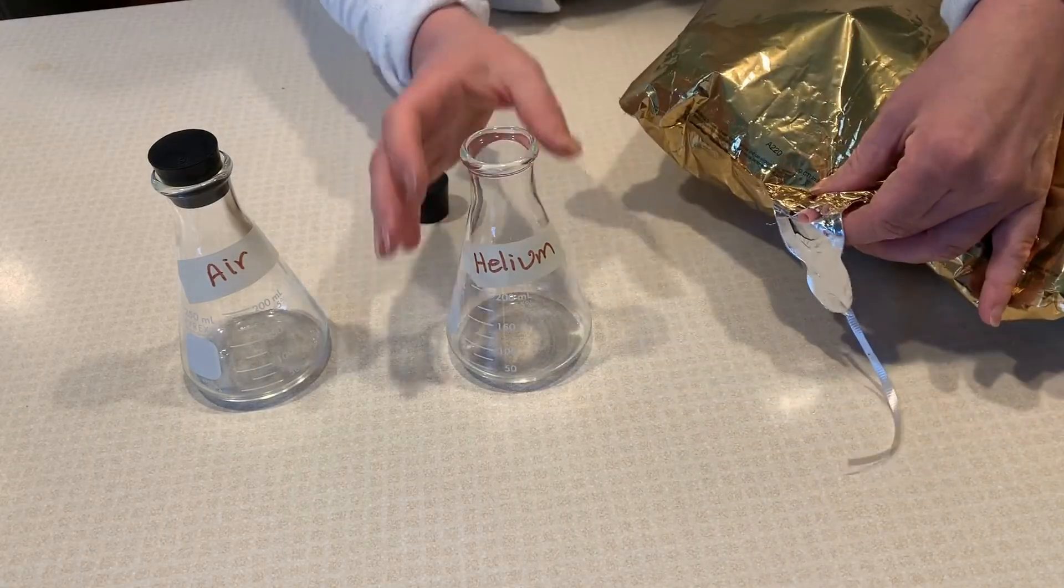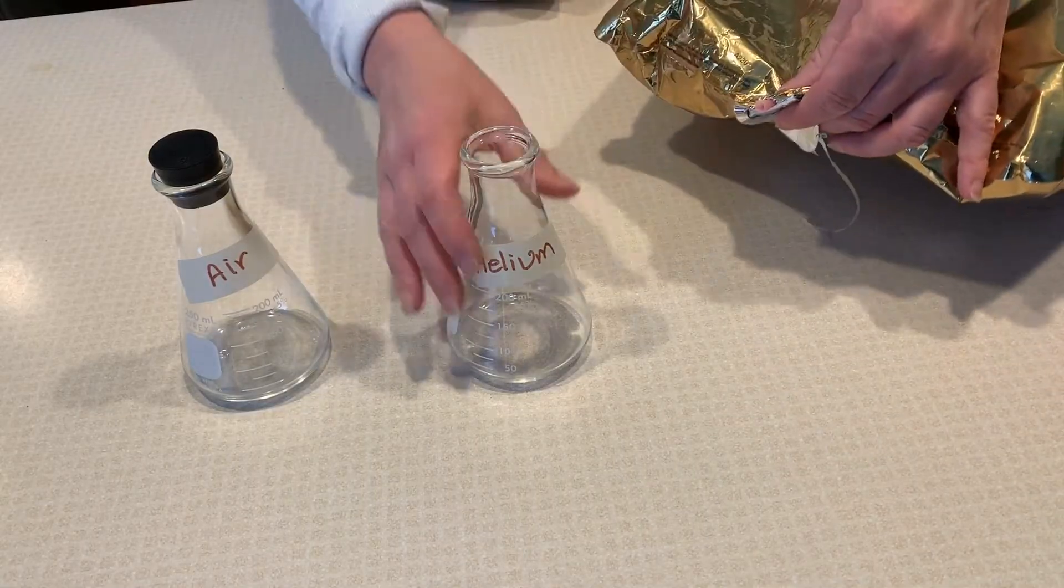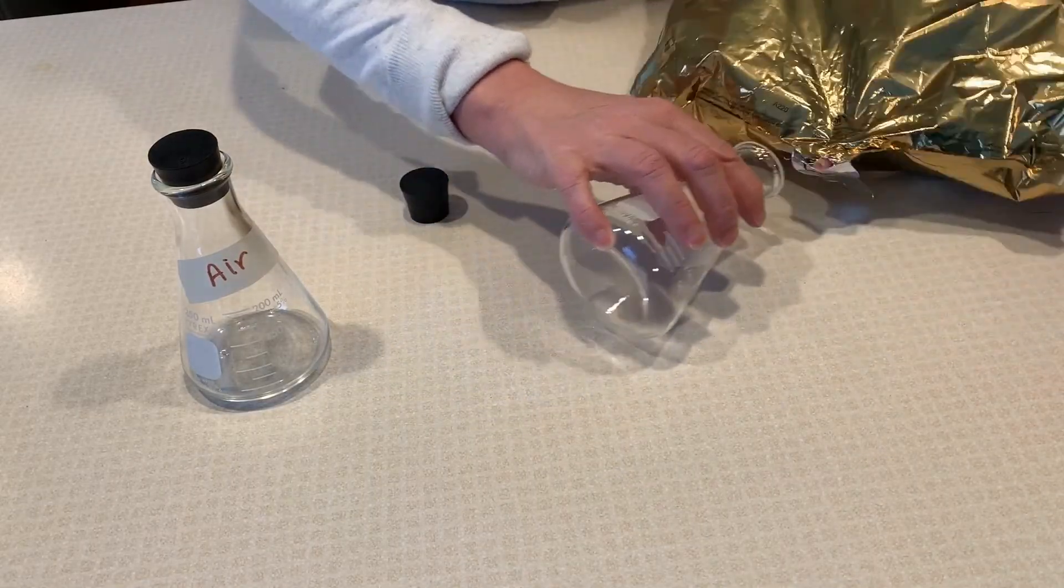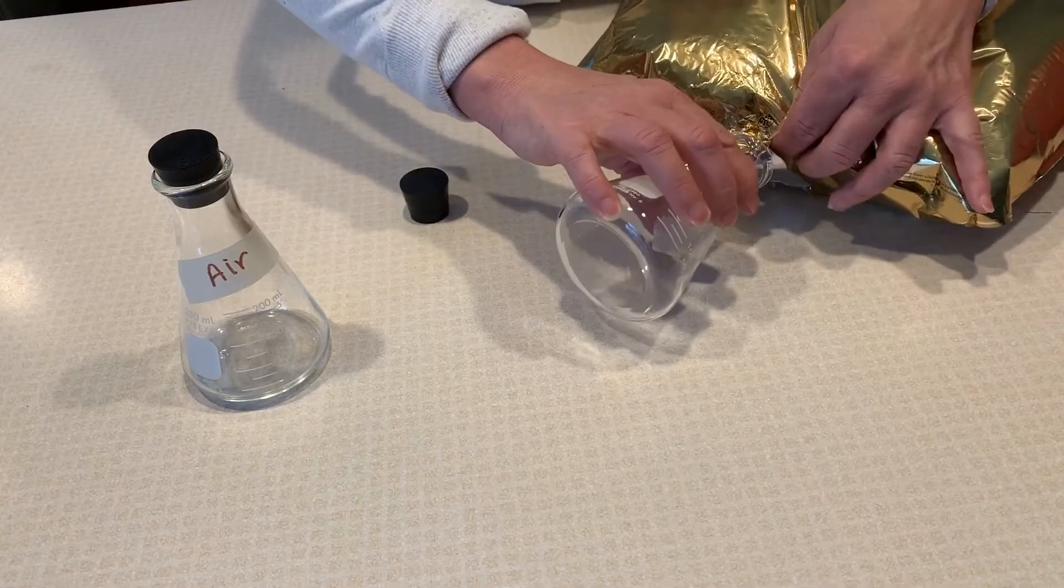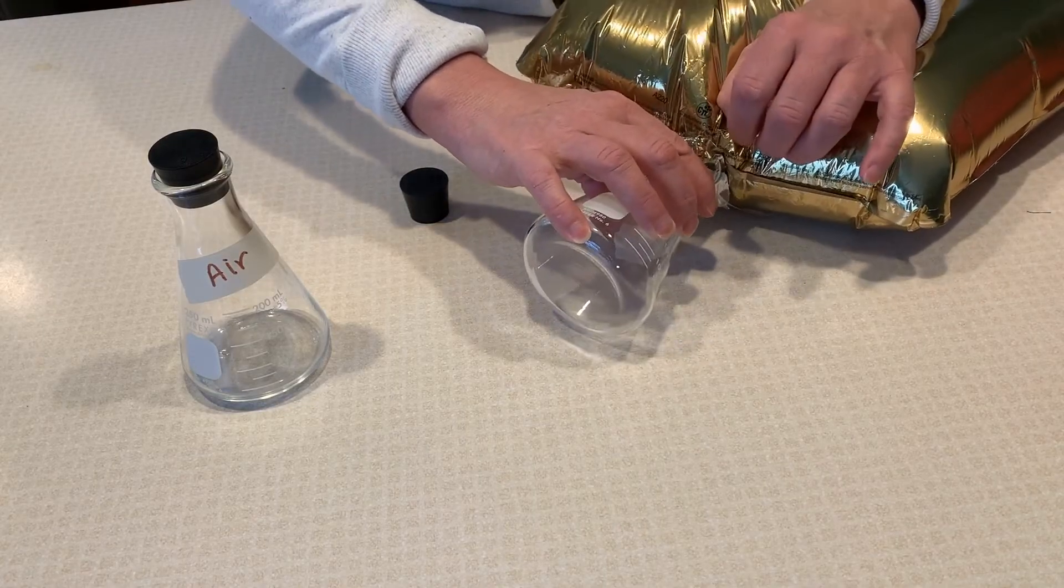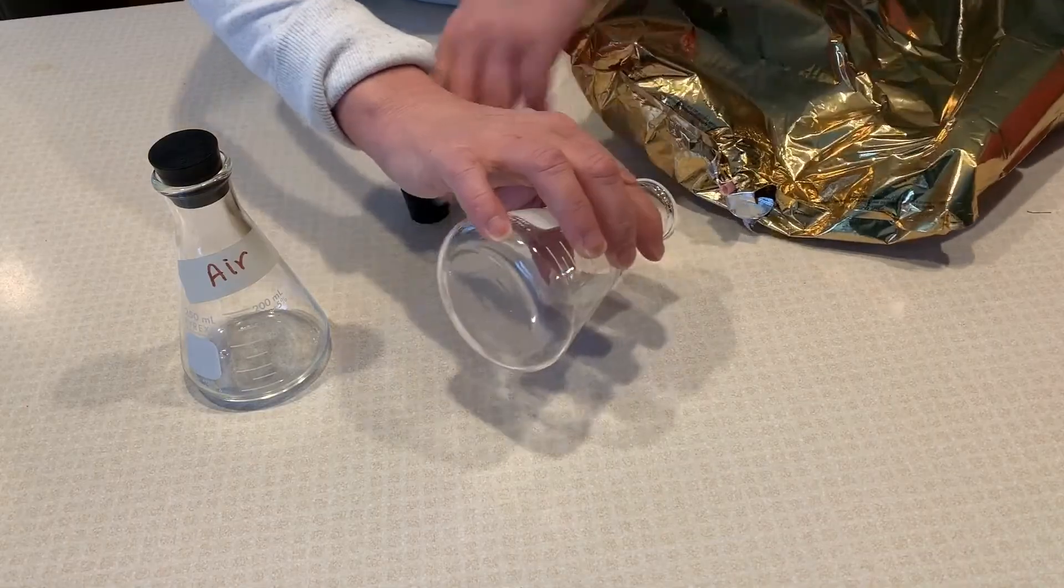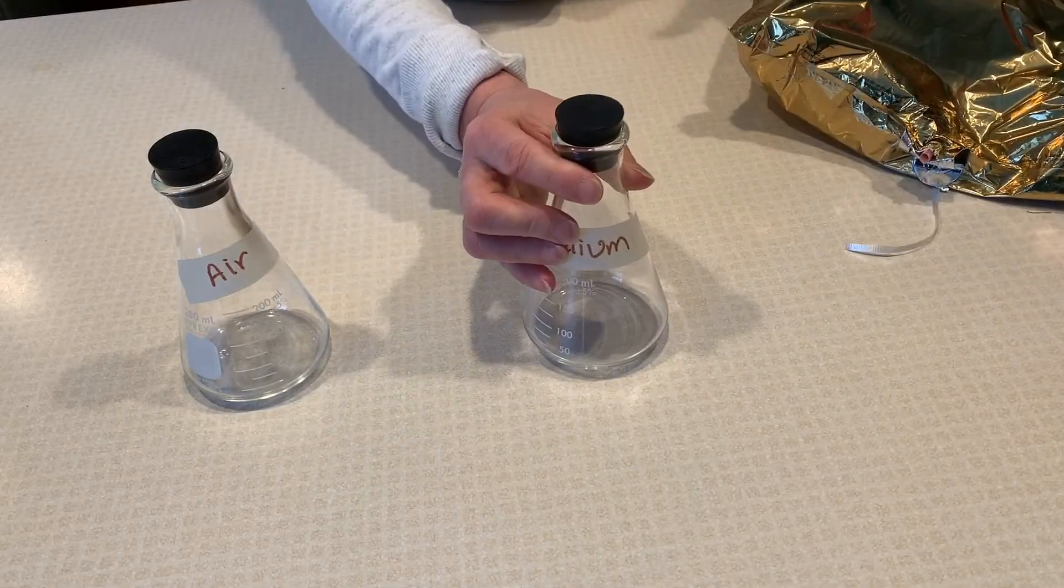I can feel the helium coming out, and then I'll put the end into the flask and push down on the balloon. It's getting filled, and then I'll cap it off.